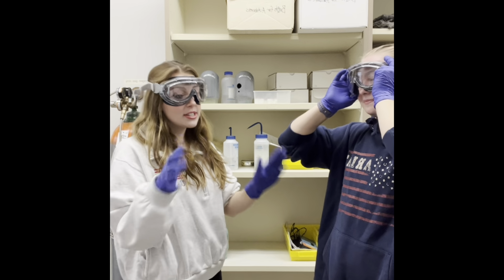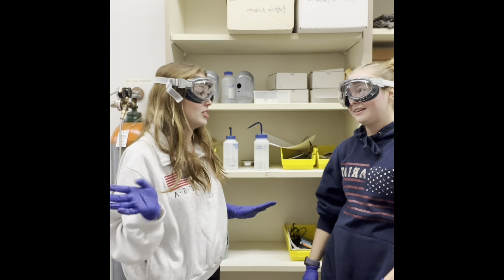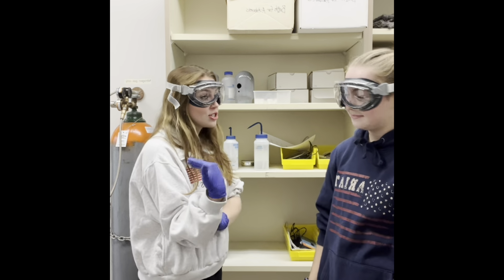Hang on. We're still technically working with chemicals in here. Even if it's unlikely, you really don't want to risk getting any of these solvents in your eye, you should probably keep them on. You're right, I didn't even think about that. Yeah. But man, I don't even know what to do next. That's okay. I can show you.